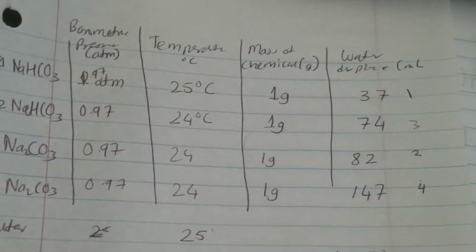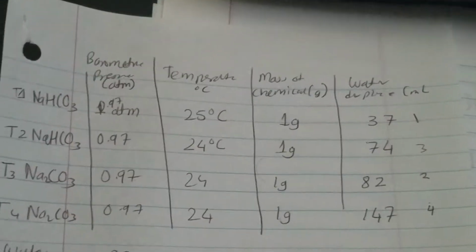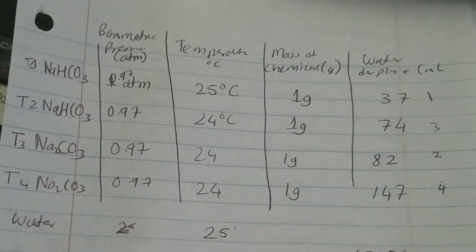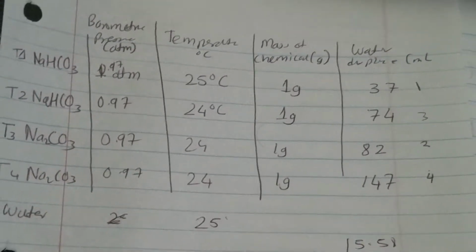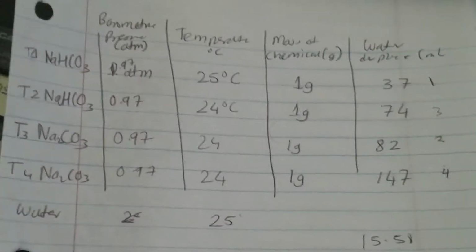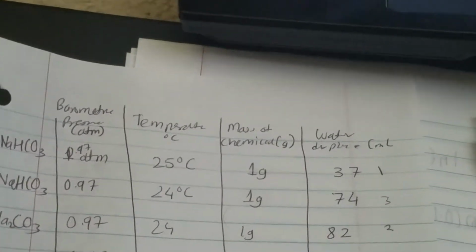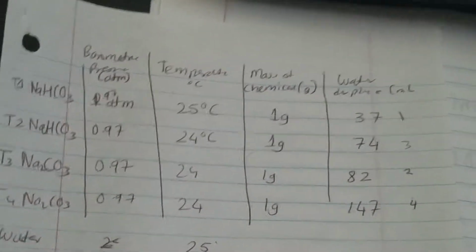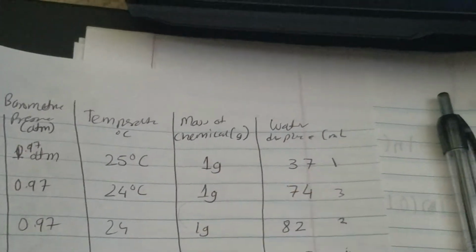But the second time I pushed it down a bit, and I was also quicker while putting the rubber cork on flask 1 when the gases were produced. So that time the displacement of the water was quite high. As you see, once I submerged the 6-inch rigid tube to twice the depth of the previous trial, I got a result almost double the previous one.